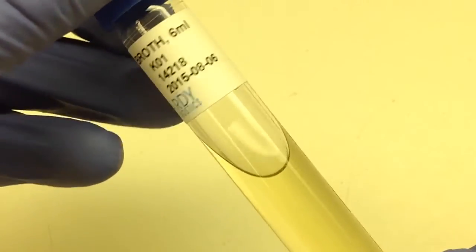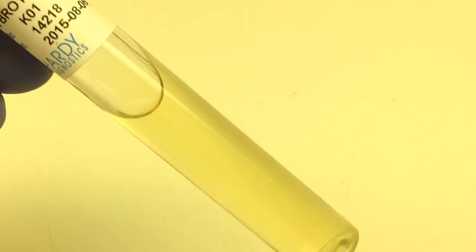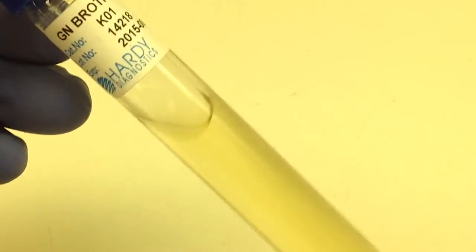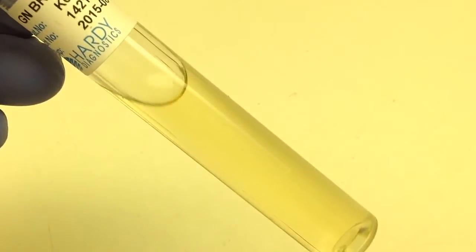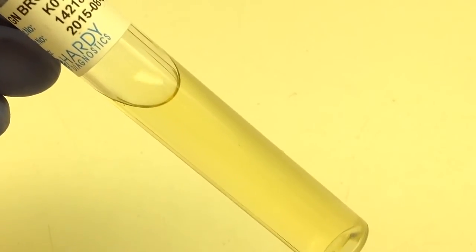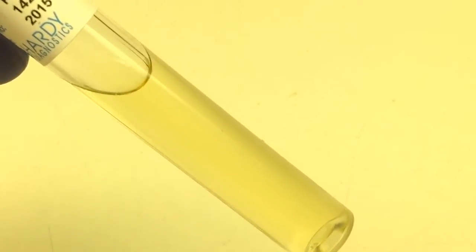This is gram-negative broth. This is a broth that is set up with stool cultures to enhance the growth of Salmonella and Shigella.